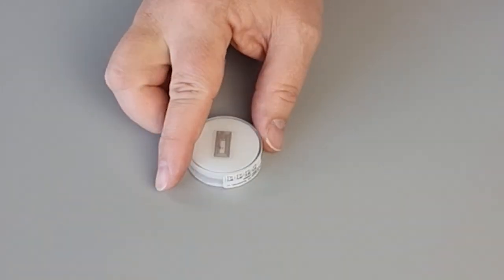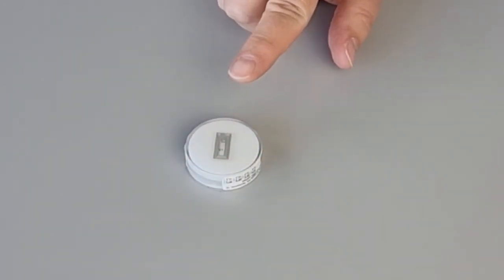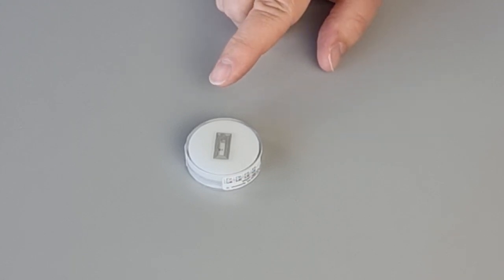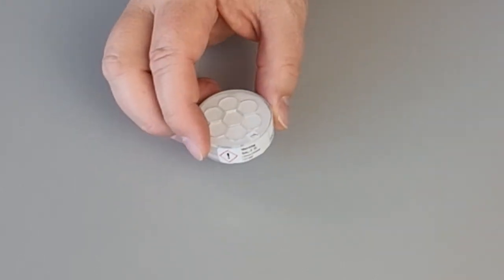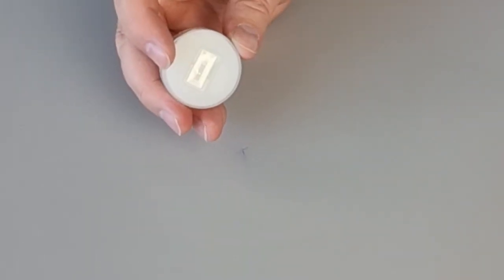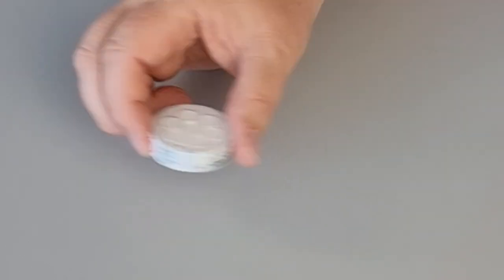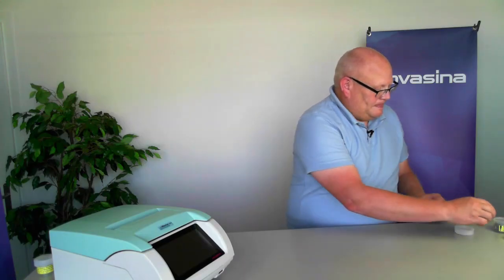Now, another way that these standards can have problems is if that RFID chip on the bottom gets damaged. That's how the LabMaster Neo determines what standard it is through its auto calibration process. So it's never a good idea to take these standards and slam them on the table on the bottom because that could damage that chip. If you just shake them in your hand, that's plenty. It's a good idea to shake them before you use them just to make sure they're fresh.